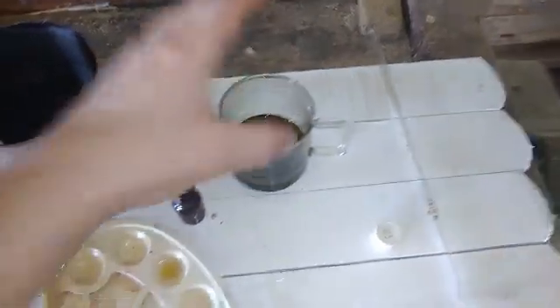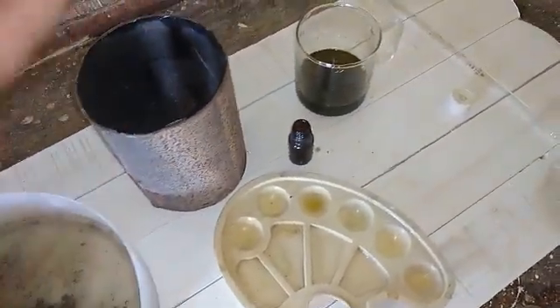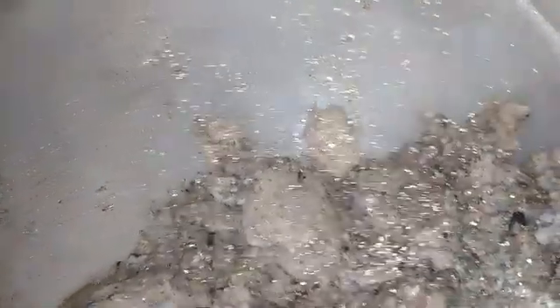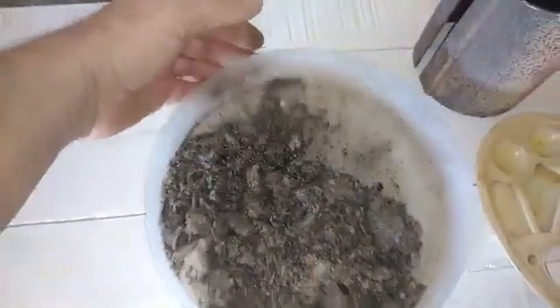I really don't know what this is. It's not noble metal, definitely. If they were platinum, they should be dissolved. If they were palladium, should be dissolved. If they were rhodium, silver, gold — anything should be dissolved. But these flakes don't contain any of that metal. It's maybe some kind of titanium alloy — I don't know. A lot of them. So this is just worthless material. Go to junk.